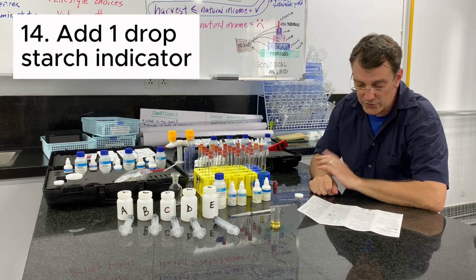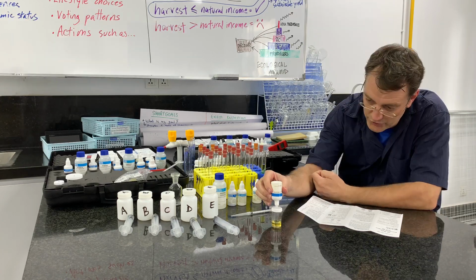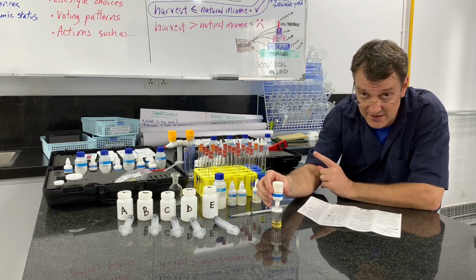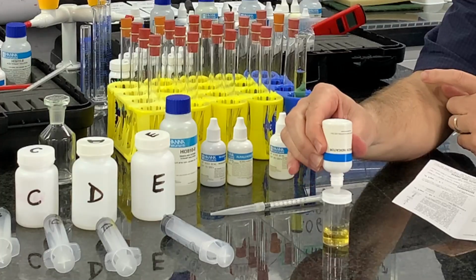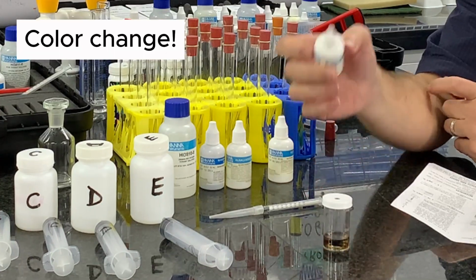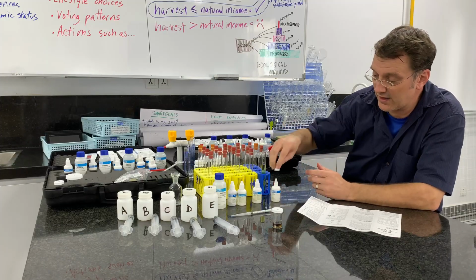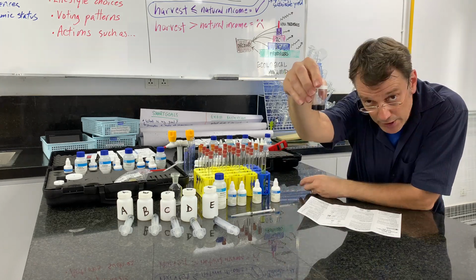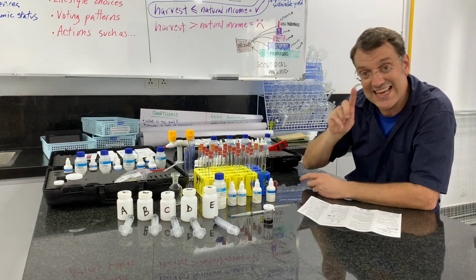Add 1 drop of starch indicator, and what you should see when this starch indicator hits the yellow solution is an instantaneous color change. Boom. It looks like the iodine clock reaction, if you've seen that before. Now, this whole solution is deep purple. That's why the starch is an indicator.